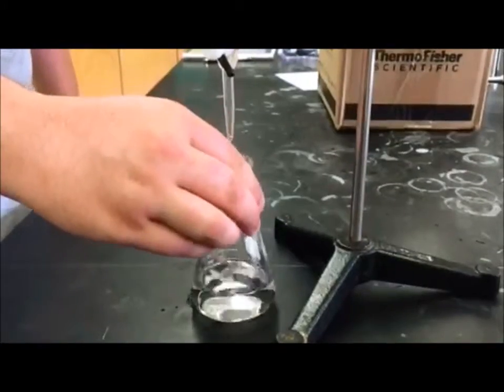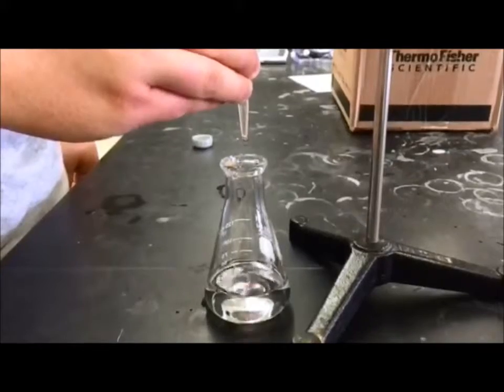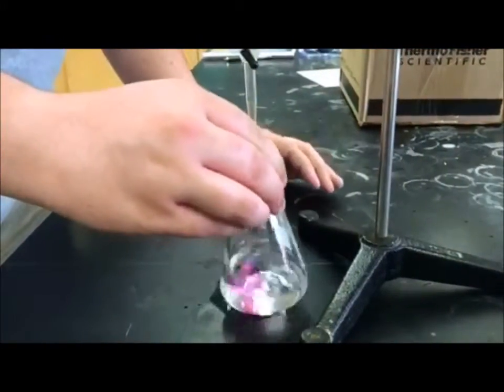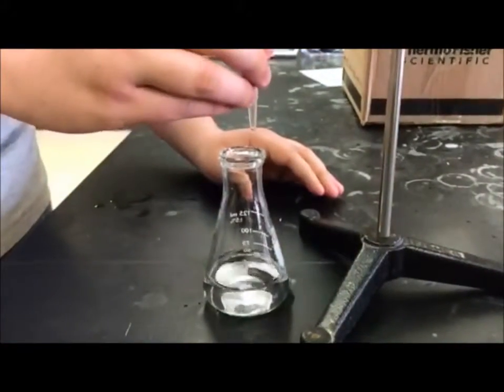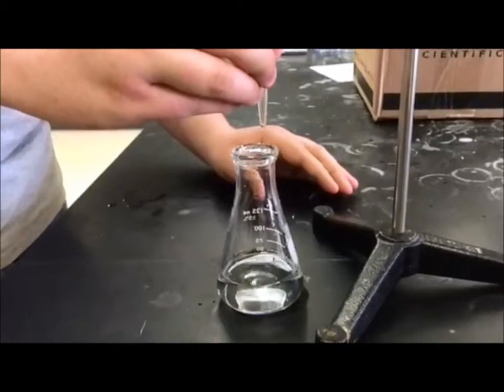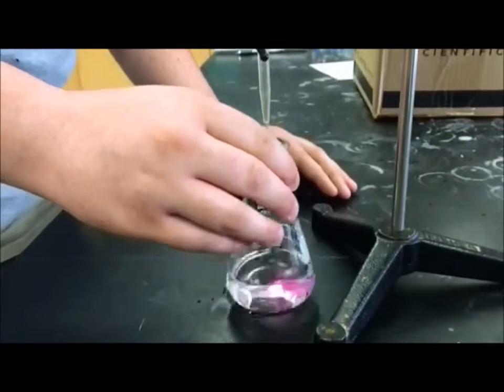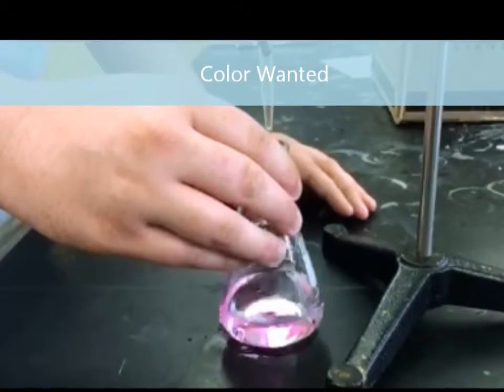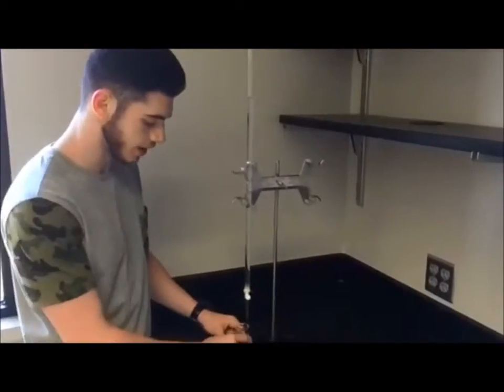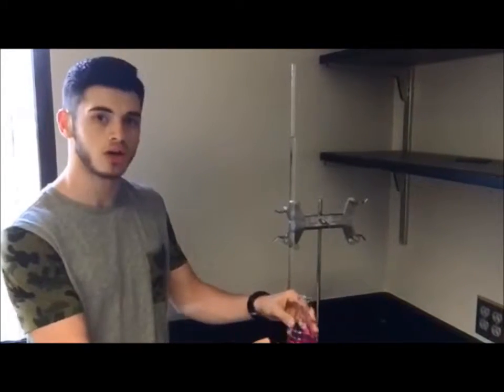You have to swirl it, and if it turns clear, do a few more drops until it turns a very light pink all the way through. And as you can see, after adding a certain amount of solution, it turns a dark pink. This isn't the color you need. Before, it had turned a very light pink. You're looking for that kind of a shade.